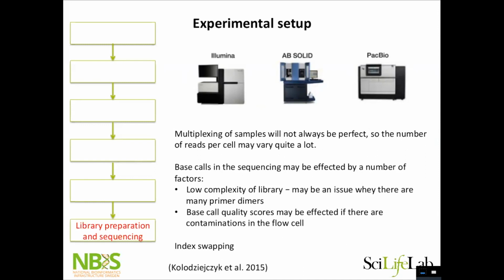And as I showed you with these FastQC plots, we can also have issues. People tend to forget this. You think the sequencing machine is always working perfectly, but it's not. You might have just an air bubble or some contamination in your sample that will make part of your flow cell fail, and you will have a lot of low quality reads. But when you look at FastQC reports for single cell data, you will often see failed, failed, failed on all the steps, just because of the nature of single cell data. You have more primer dimers in single cell data. You have a lot of bias in the beginning due to all of these primers that we have, and so on. So, a failed in the FastQC report doesn't mean that it's completely bad, but at least have a look at it. And especially if you see parts of your flow cell failing, it might be a good idea to actually resequence your data.